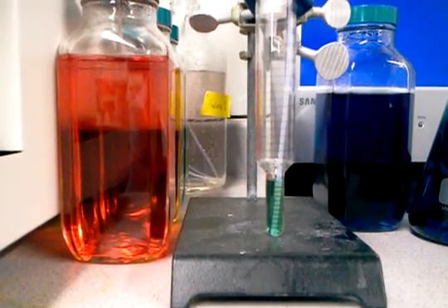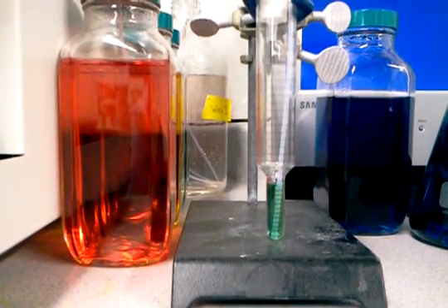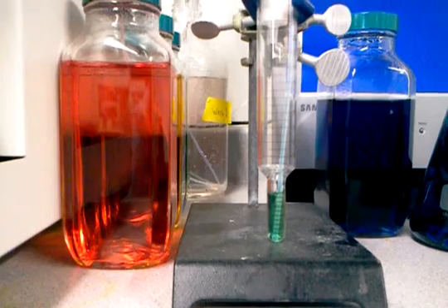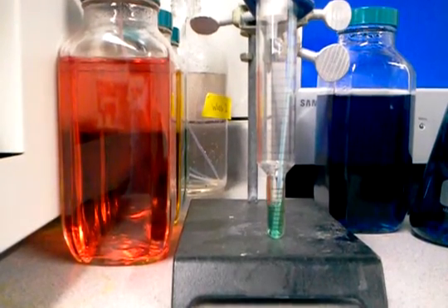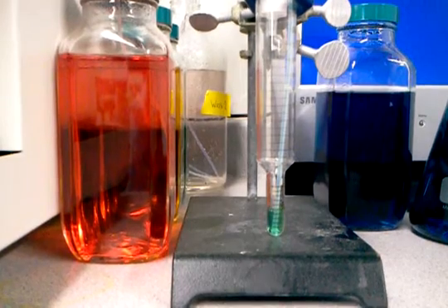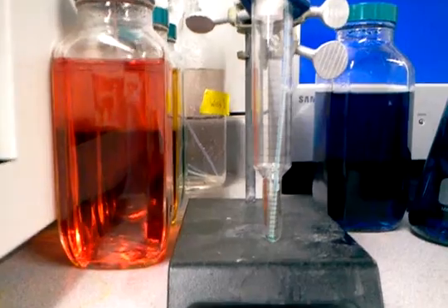The plunger is now moving to the right position, and what we will see is the green liquid starting to be pulled into the tube. I'm pulling at five mils a minute, which is a gentle flow rate.